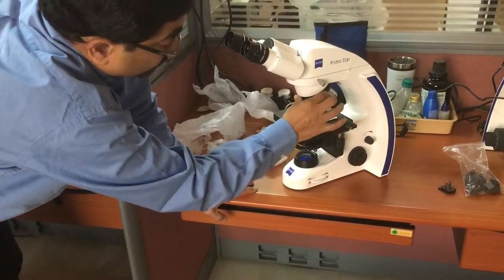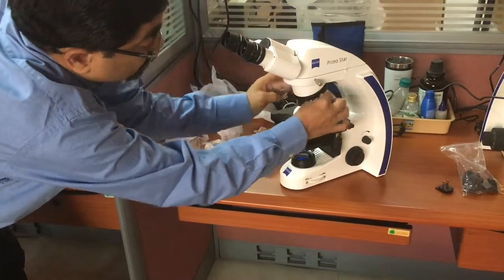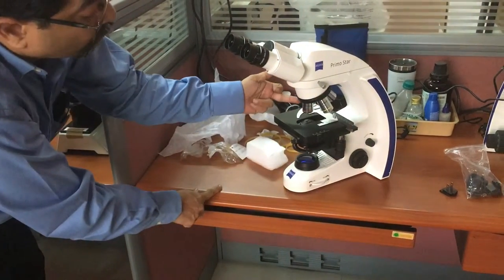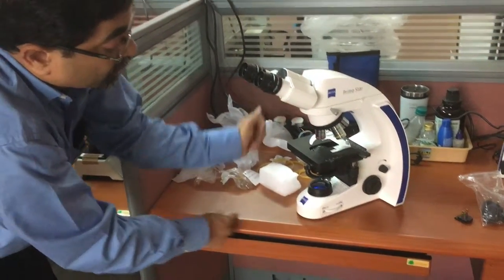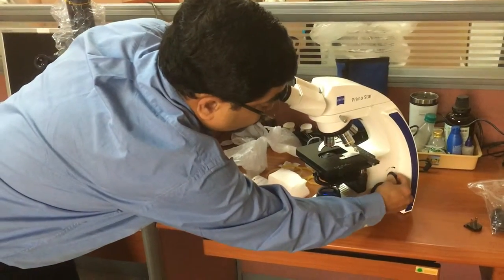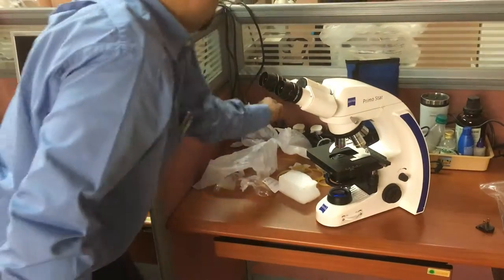Change the objective to the lowest magnification, 4X, and start the microscope.